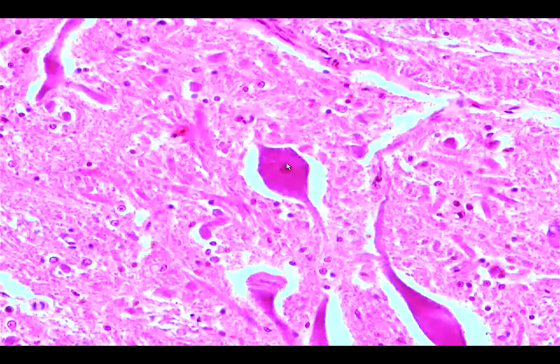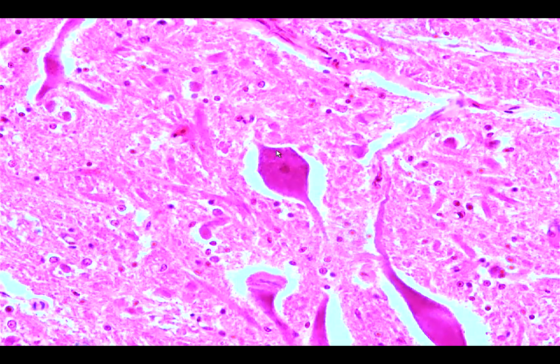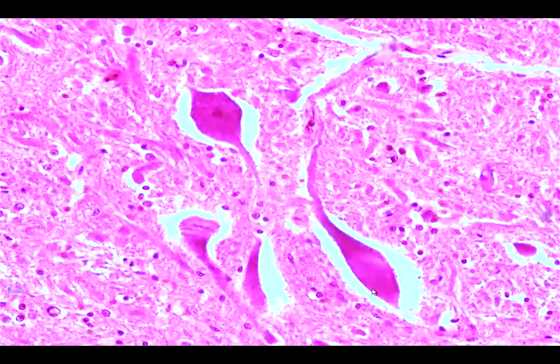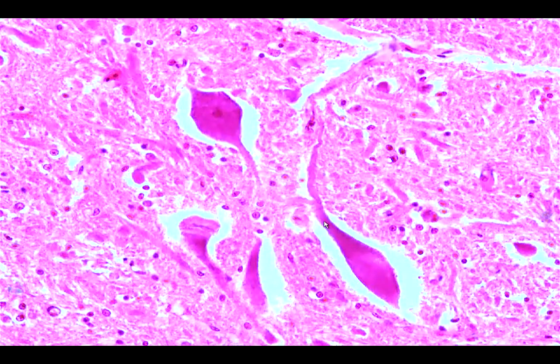There, let's try to see this one. Okay, so you can see the presence of those colored structures, which are called the Nissl bodies. The Nissl bodies are actually the rough endoplasmic reticulum that would contain the ribosomes. So how to differentiate an axon from a dendrite? If you do not see Nissl bodies going into the process, then it's an axon, which is the case here. If you see the presence of the Nissl bodies going into the process, then that's a dendrite.